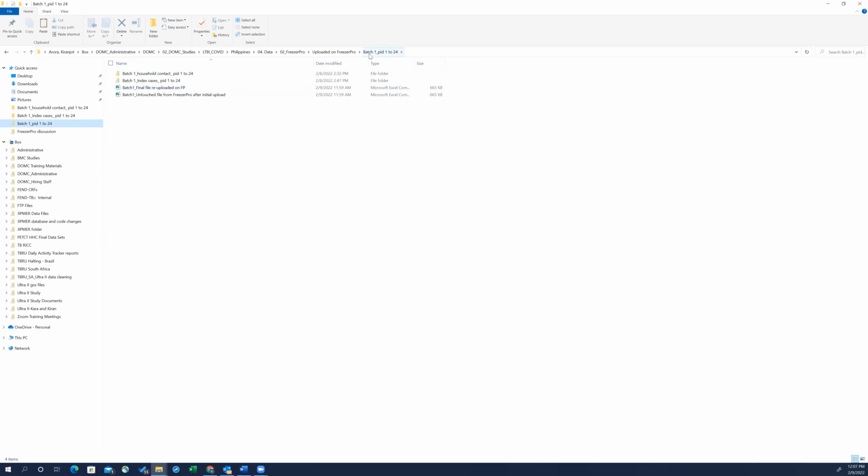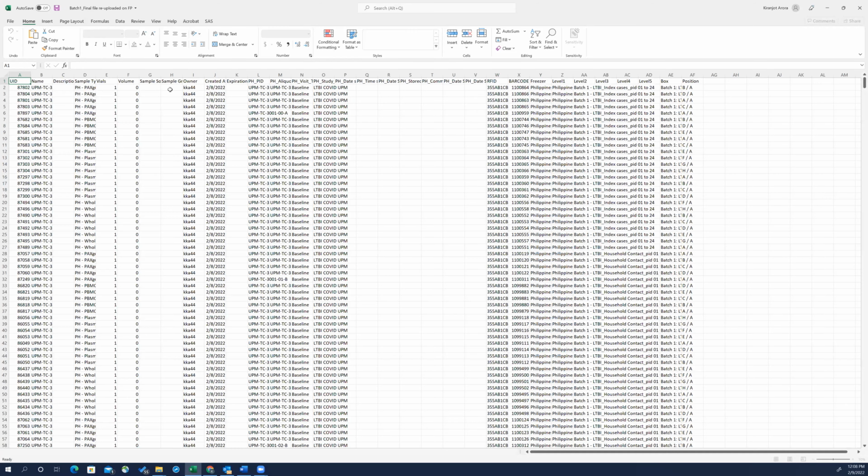And I've saved it here in the first batch. So these two are the same files. First I saved the CSV file from the downloads here and I called it the untouched file from the FreezerPro. It's very important to keep a copy of the initial database in case, when you're making changes, something gets disrupted, you can go back to what you had before. So anytime you're making any bulk changes on FreezerPro database in this manner, please save an untouched file.